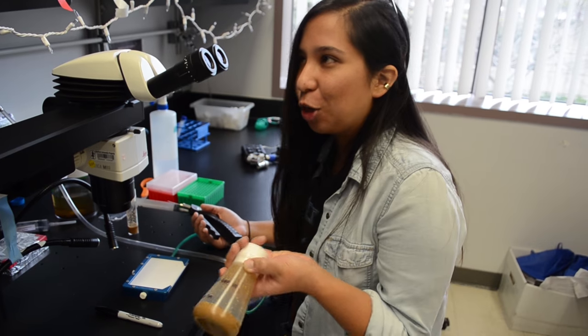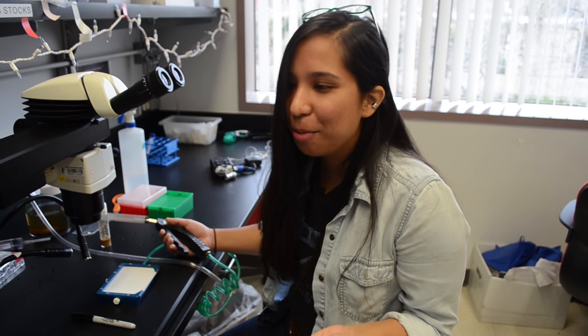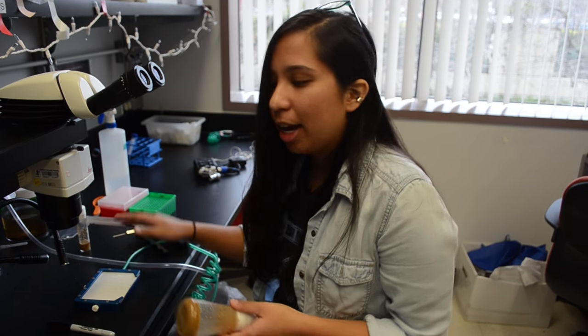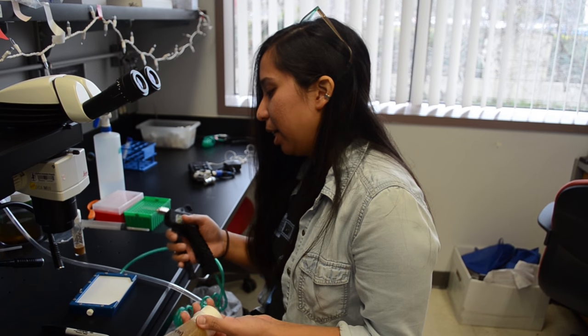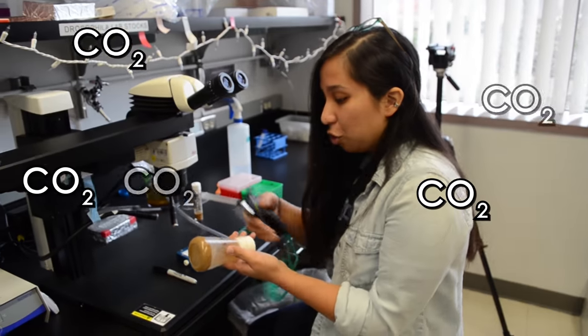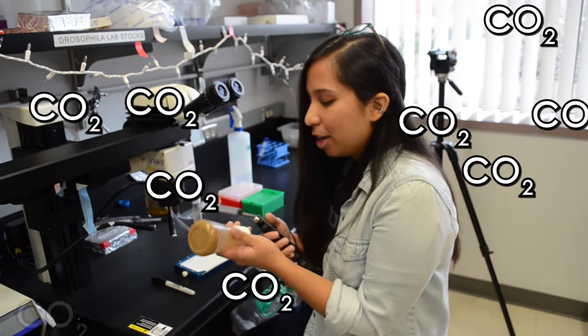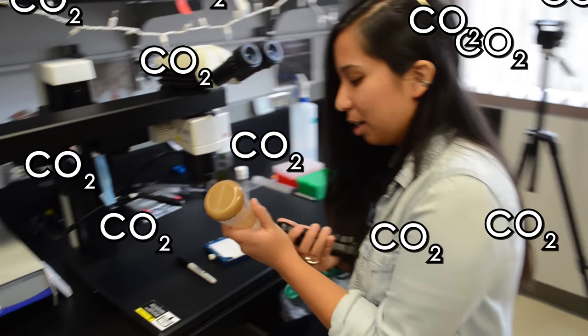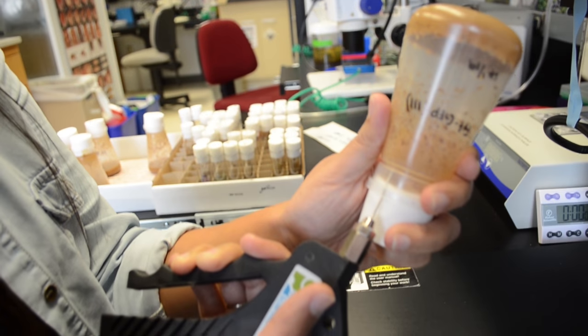One of the first questions I get asked whenever someone who isn't a fly biologist comes into the lab is how do you work with flies. We use CO2 — this is a CO2 gun that we use to shoot CO2 into the bottle. It knocks the flies out and keeps them from moving so we can work with them more easily, and once we take them off the CO2 they'll wake up again.